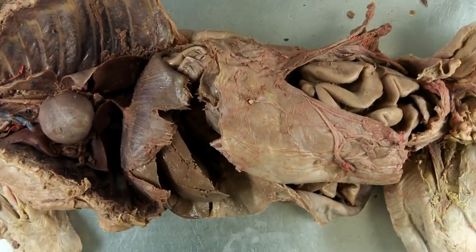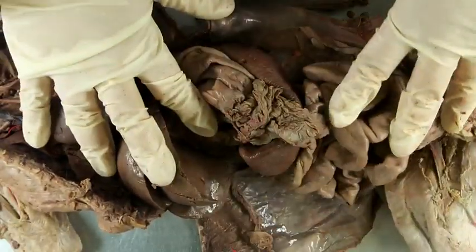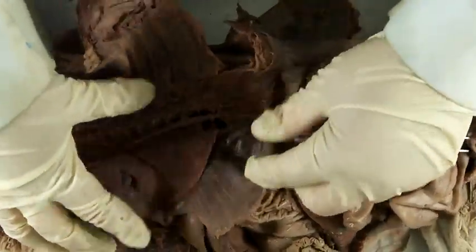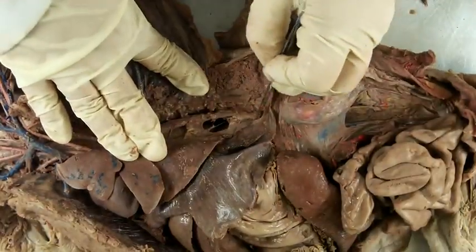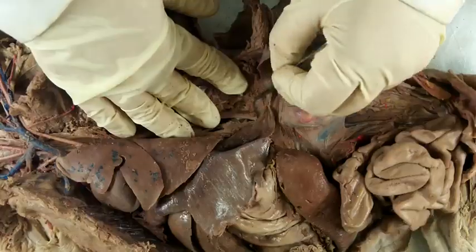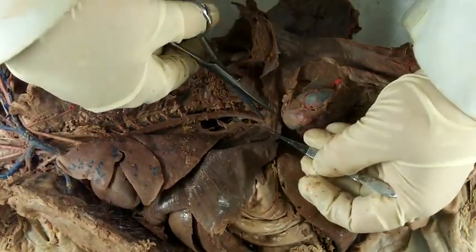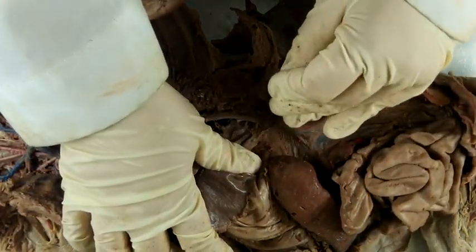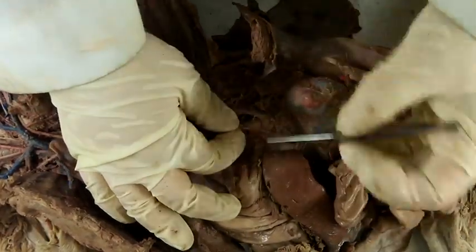The next dissection is the arteries and veins posterior to the diaphragm. Here's the diaphragm, and if we open this up, there's a lot going on here. So the best place to start is to go back to where we were in the last dissection at that thoracic aorta. The thoracic aorta continues into the body cavity, and if we cut through the diaphragm at the level of that thoracic aorta, we can start to expose the abdominal aorta. It's still the same structure, it's just located within the abdomen.